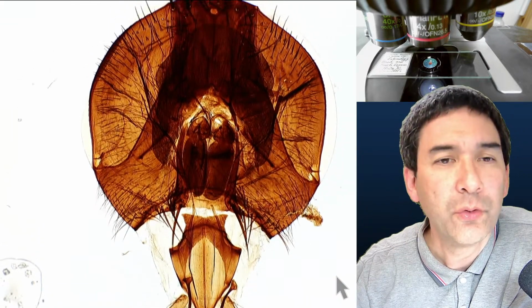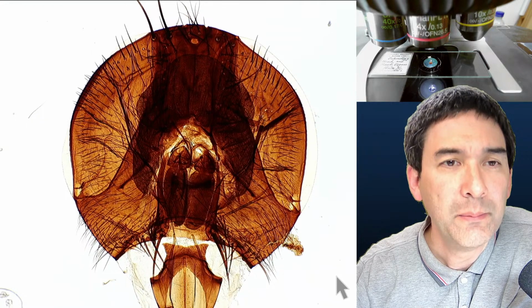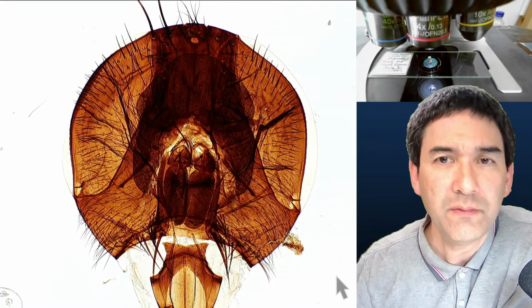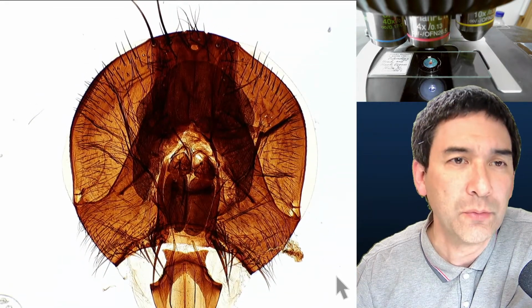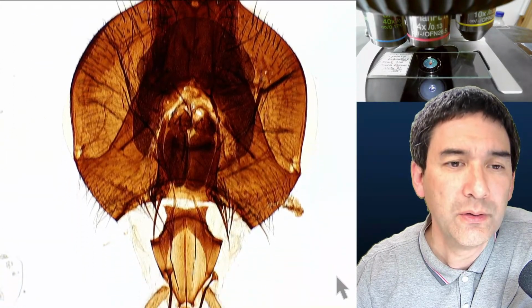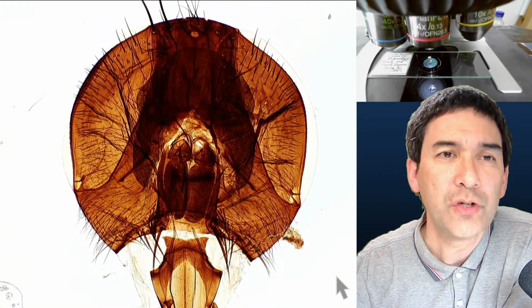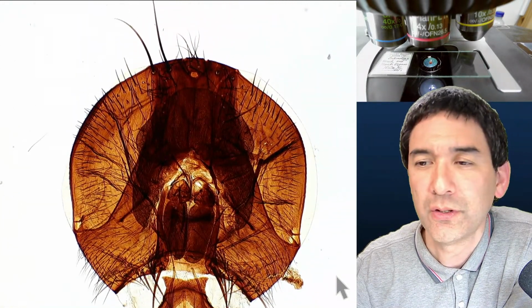Unfortunately, I did not make a video of this, and I cannot do that right now either. But what you see is that even at the lowest magnification, it is not able to fit into the field of view. So it would be quite easy for me to simply make a video here, like this, and then use that video for generating a large image.